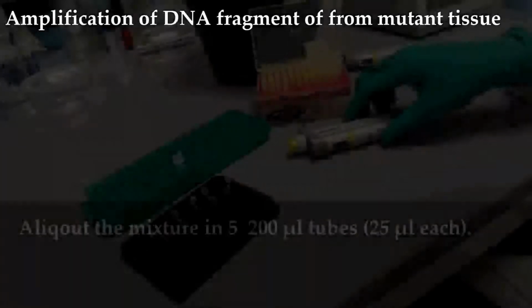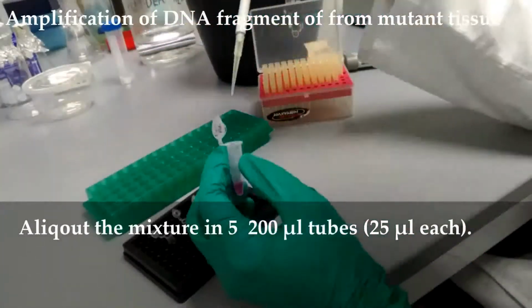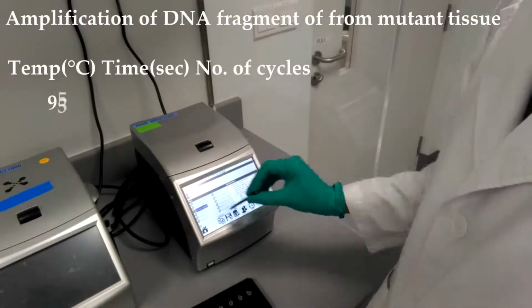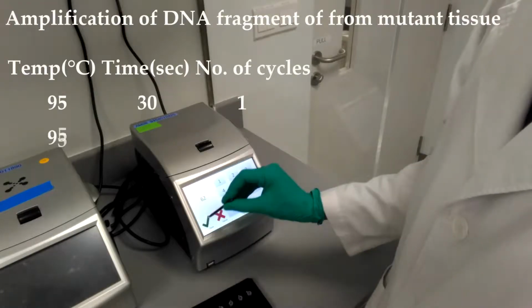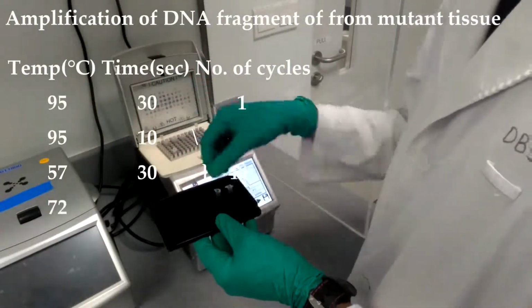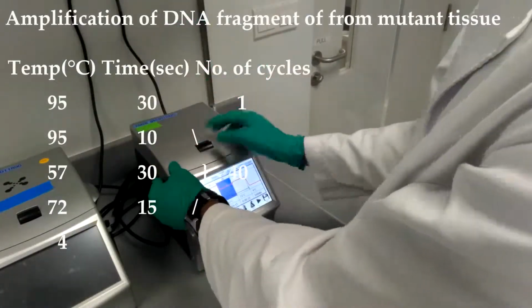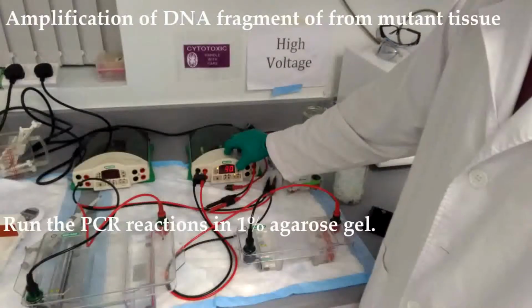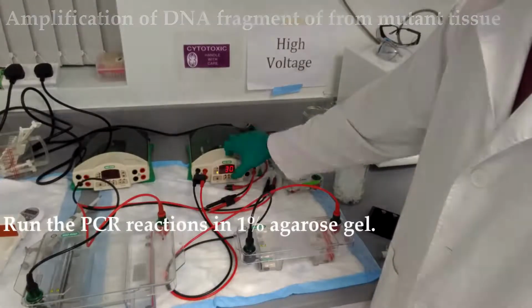Vortex the mixture. Aliquot the mixture in 5 200 microliter tubes. Set up PCR reaction with settings as shown on the screen. Run the PCR reactions in 1% agarose gel.